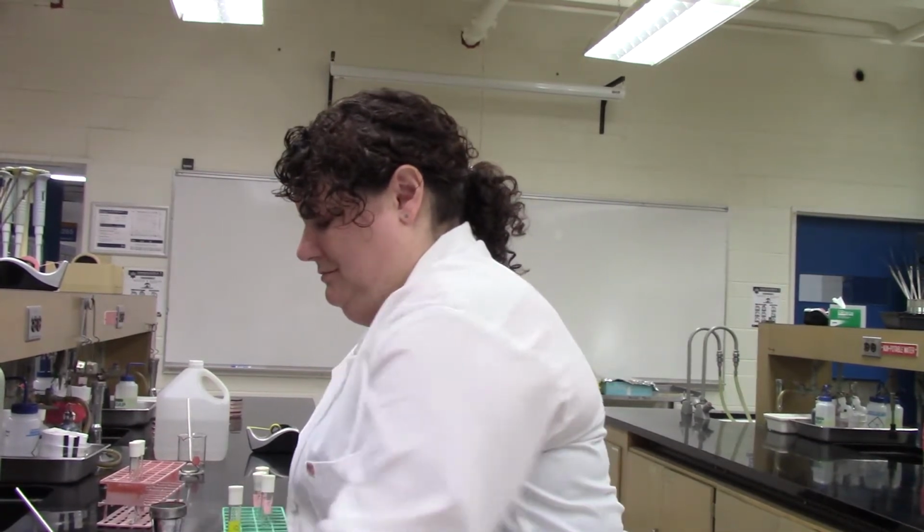Hi everyone, we're back again with another video tutorial, this one on the use of selective and differential media. You've learned a bit of the theory of this, and we'll talk more as we go through the lab about the theory of this type of media and how it works. And there's a fun added bonus.